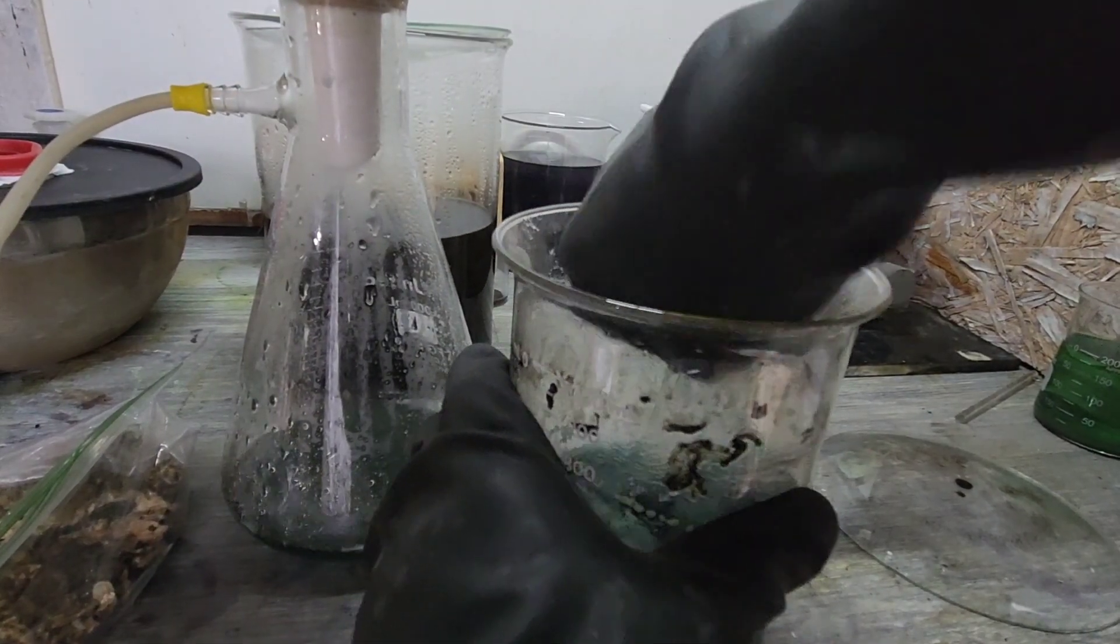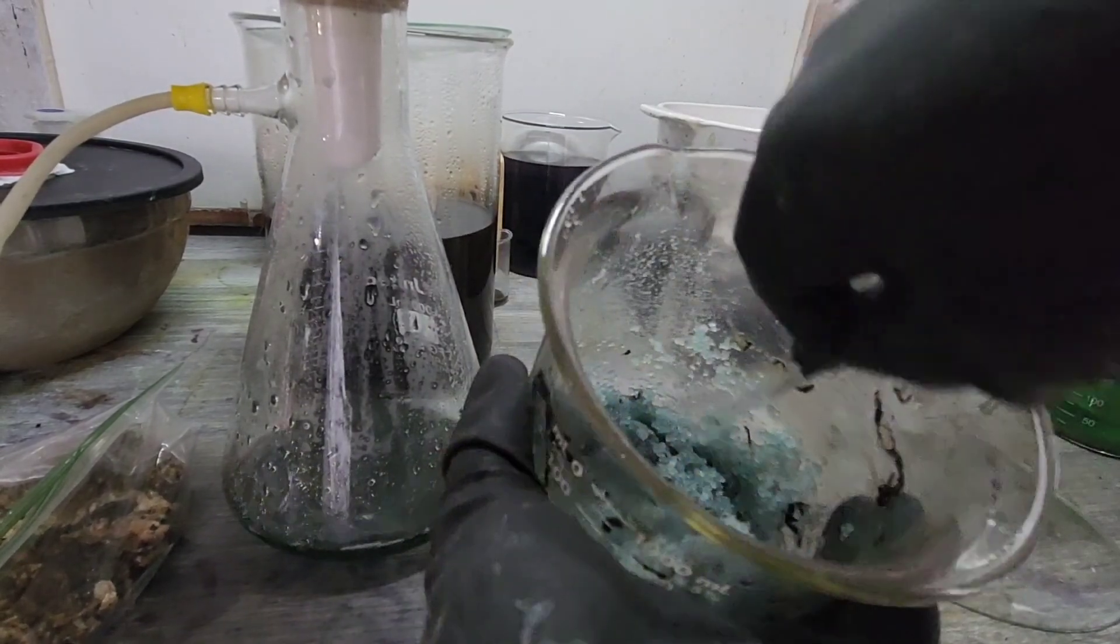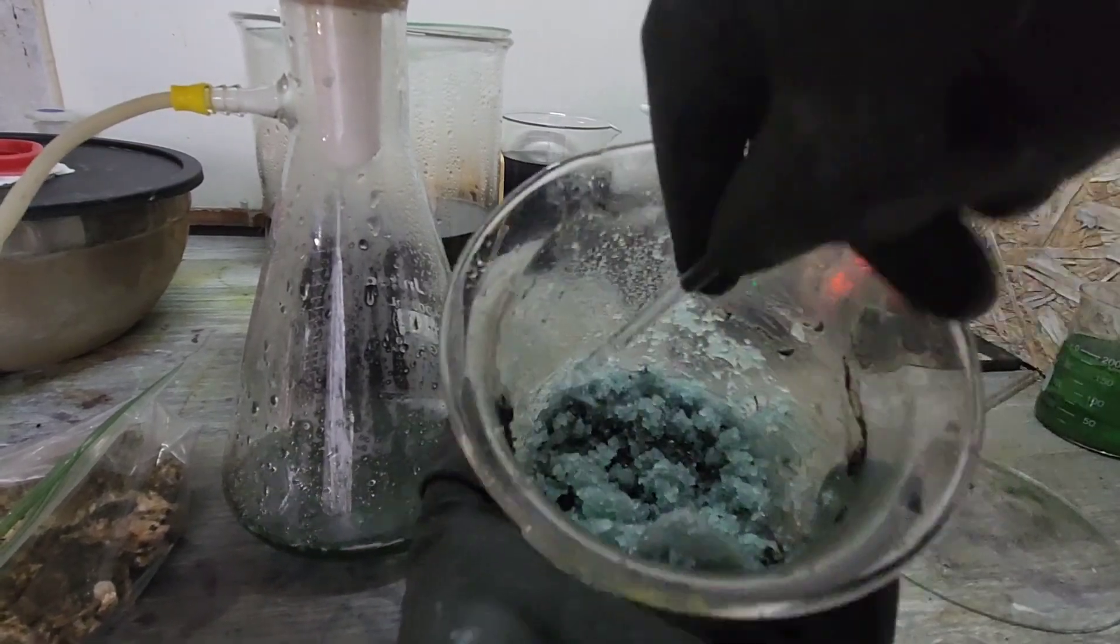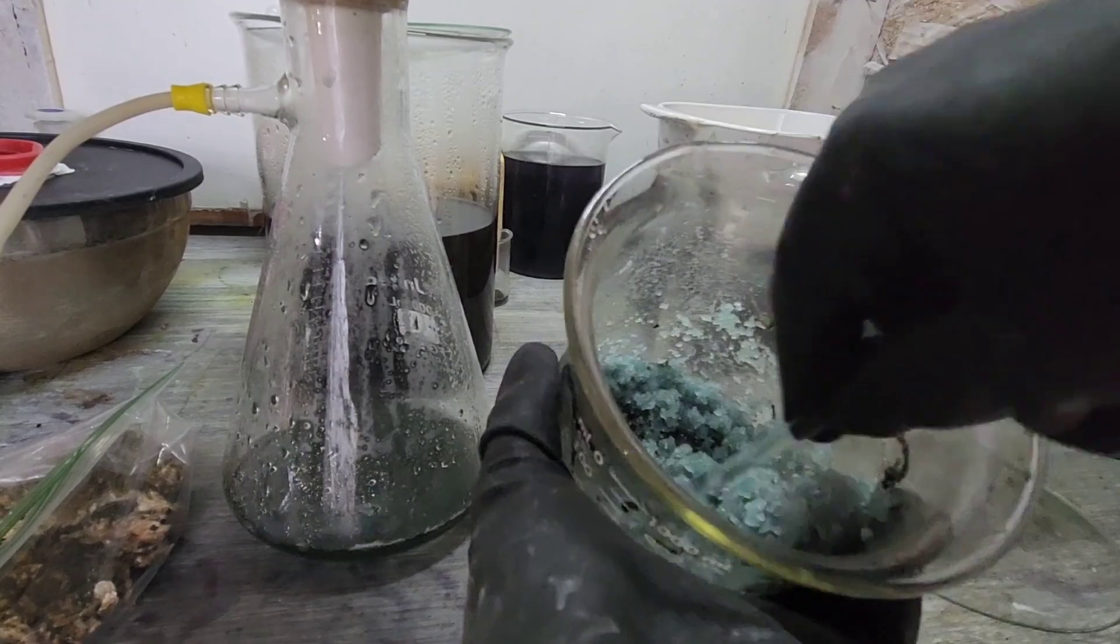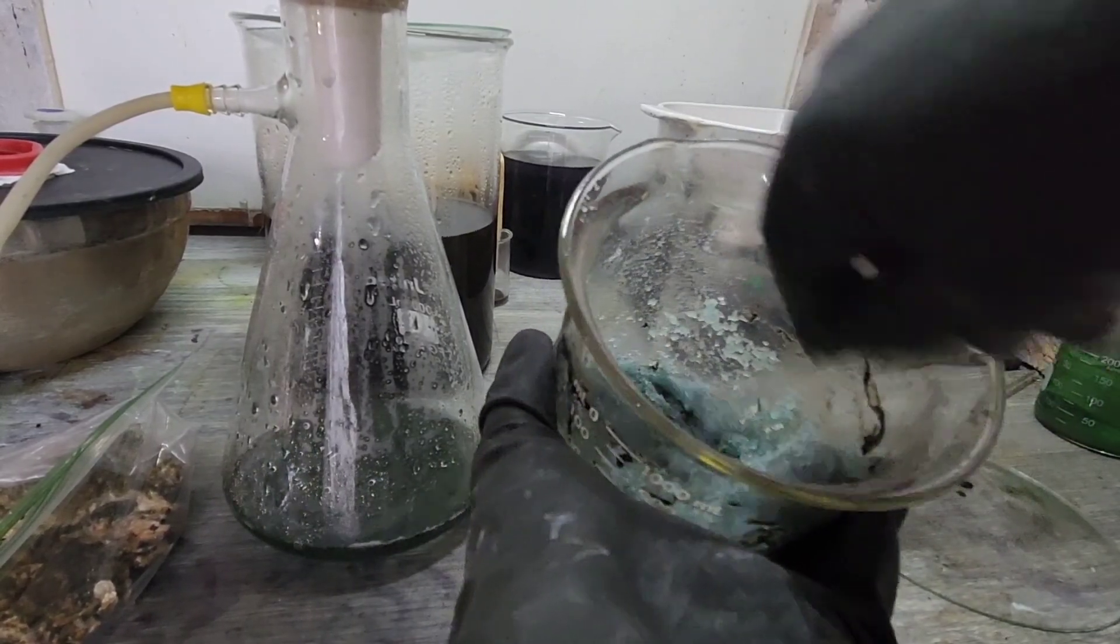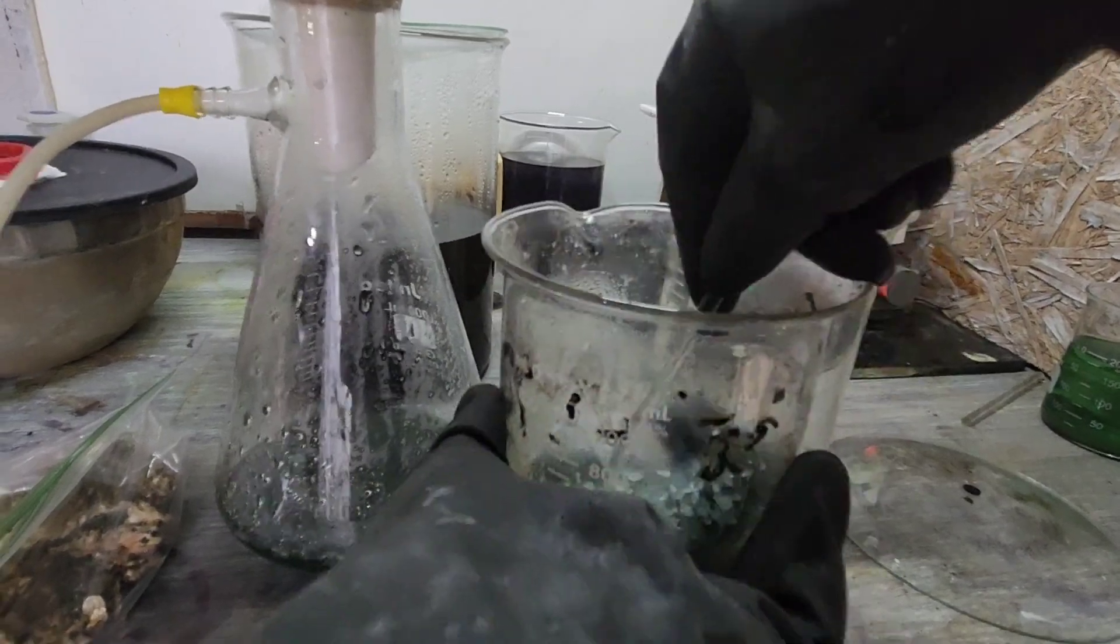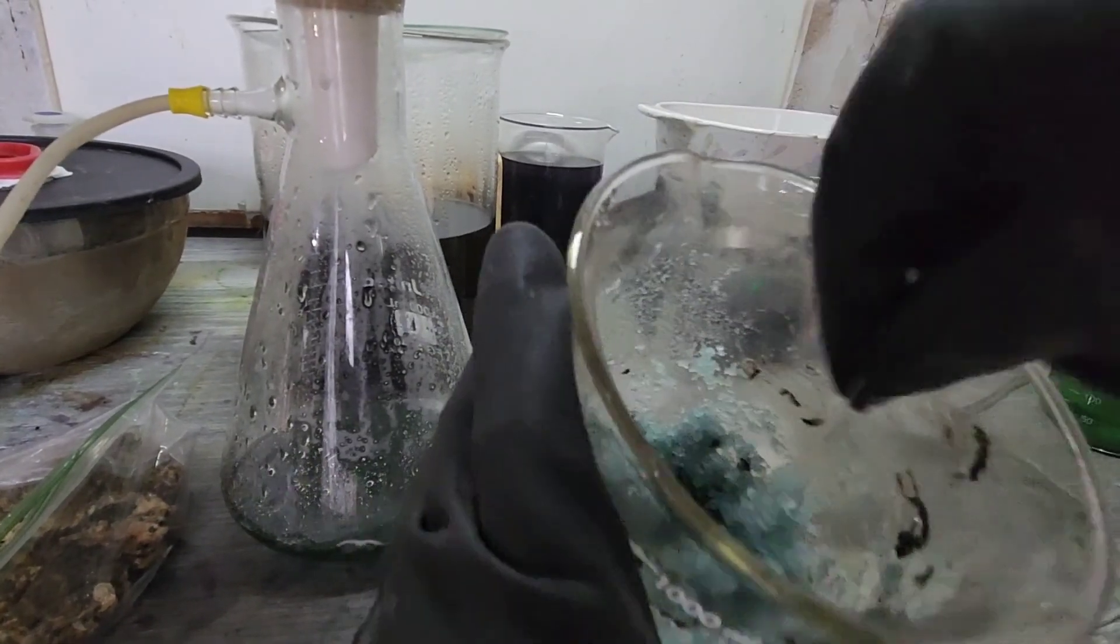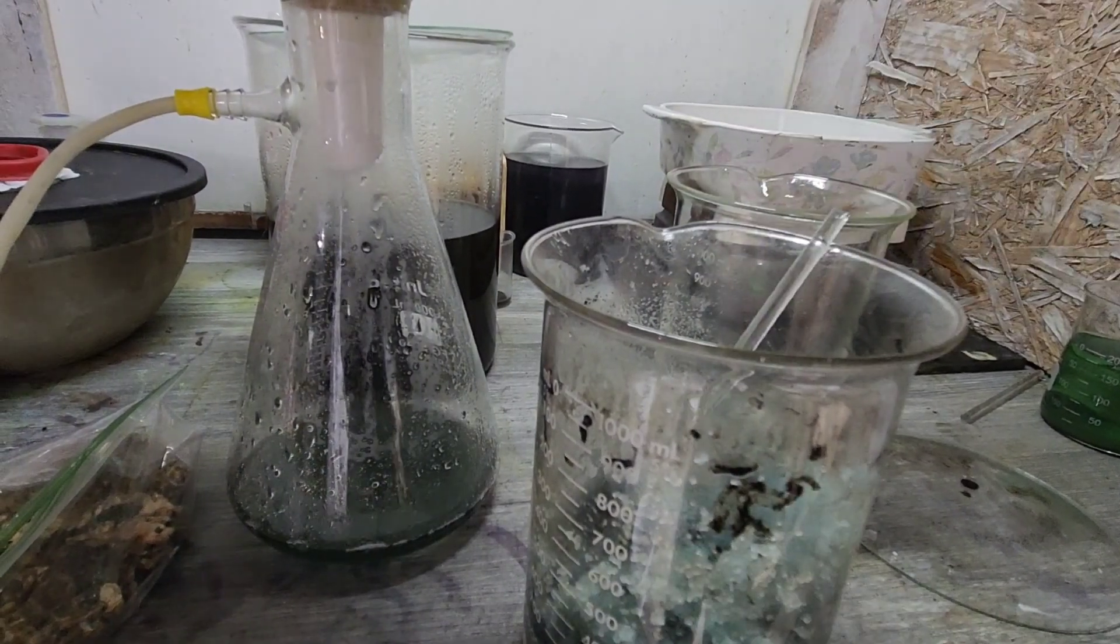They look pretty good. We're definitely going to want to rehydrate them so we can filter them though, because there's a lot of stuff that I don't want in there when I drop the gold out. So we'll get to that here in a minute.